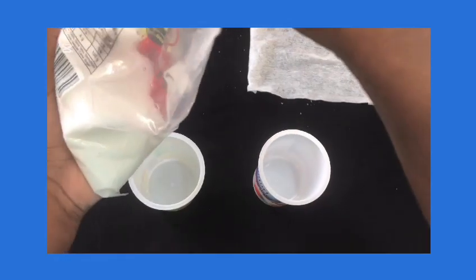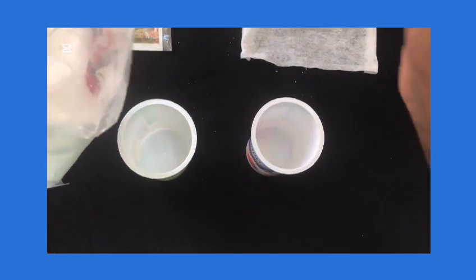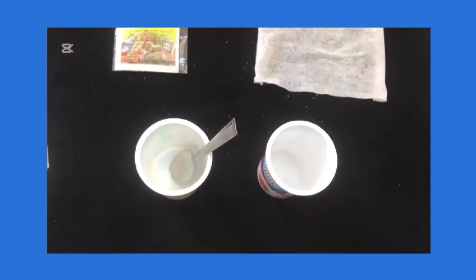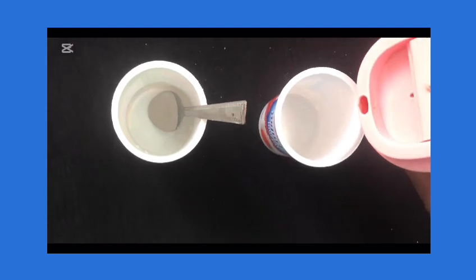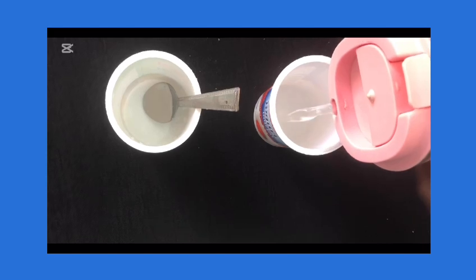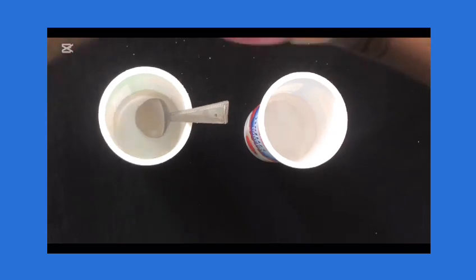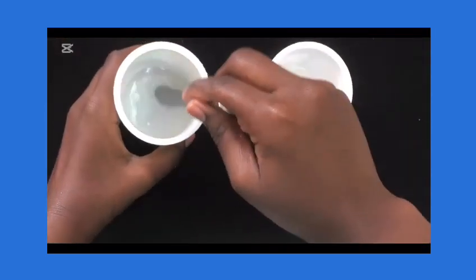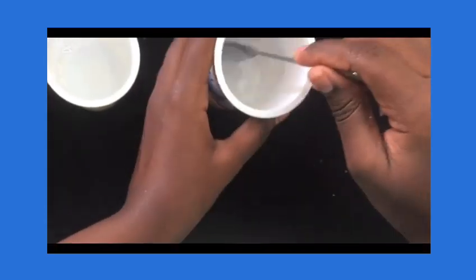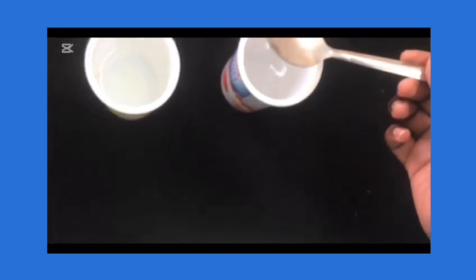We will begin this experiment by adding the same amount of sugar to container A as well as container B. So you must pay attention to add the exact amount of sugar to both containers because it is a controlled variable, and also the amount of water should also be the same because water is also a controlled variable in this experiment. The only independent variable is going to be the temperature of water. Now make sure to stir the sugar in the water until it completely dissolves before we proceed to adding yeast.